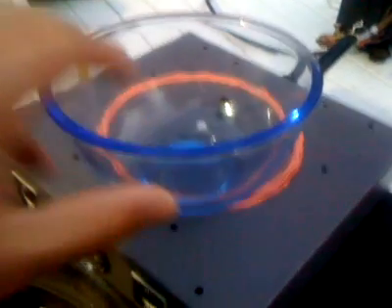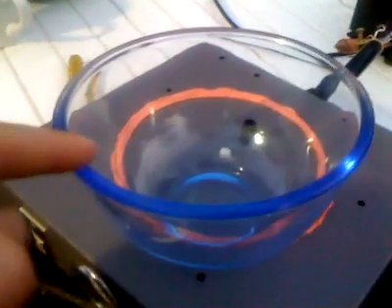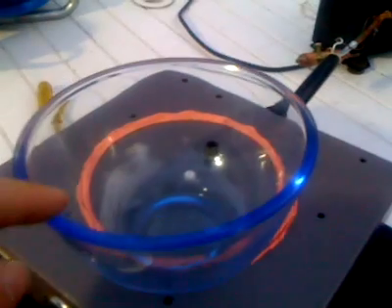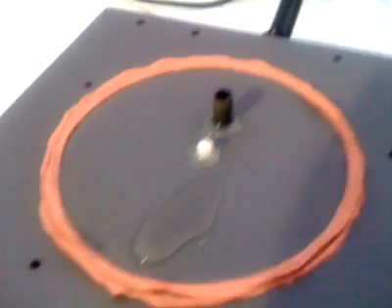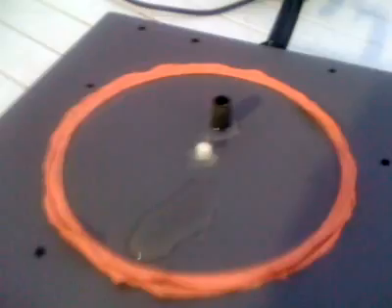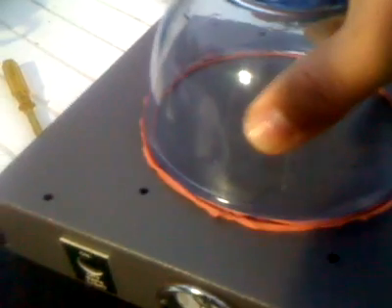Here's my jar, which is just a standard kitchen Pyrex bowl. Obviously I'm wearing safety glasses. I'm sure this is plenty strong enough, but I wouldn't like to find out the wrong way that it wasn't. In here I've just dropped a bit of tap water. I'm just going to plop a bit of tap water on the side there, get rid of the surplus, and then we can position that on the putty. I don't know exactly what the putty was, but it's kids' play putty. Right, that's ready to play. It probably isn't quite sealed down yet, but here we go.